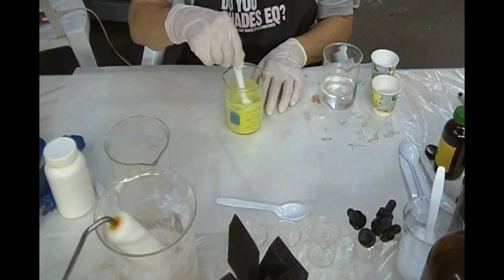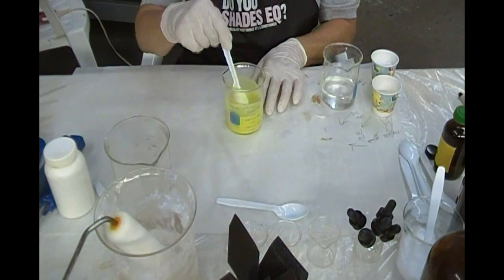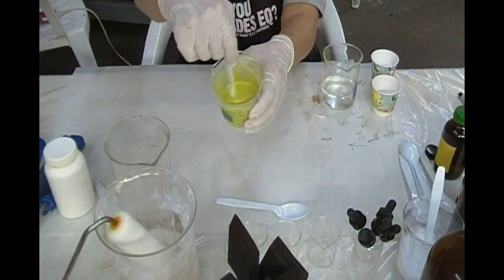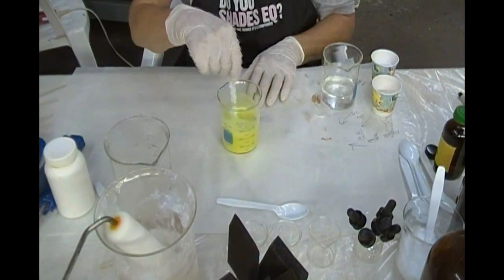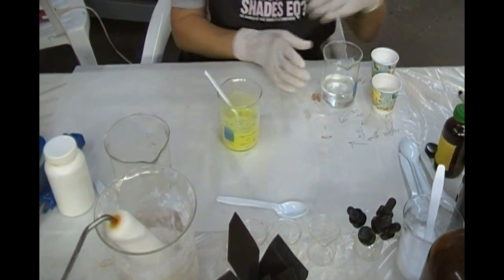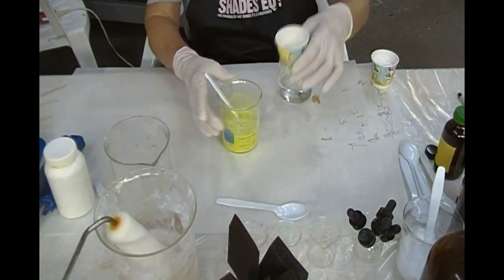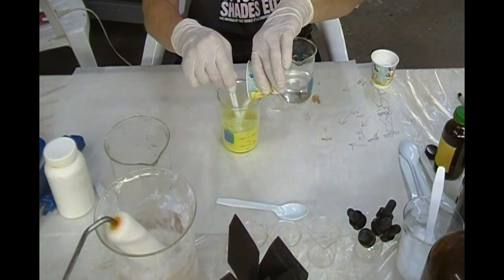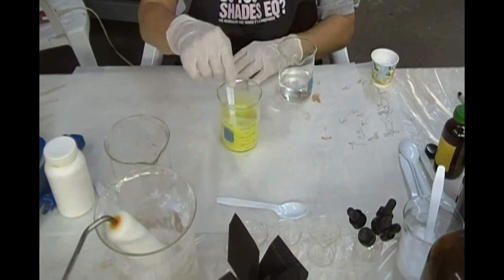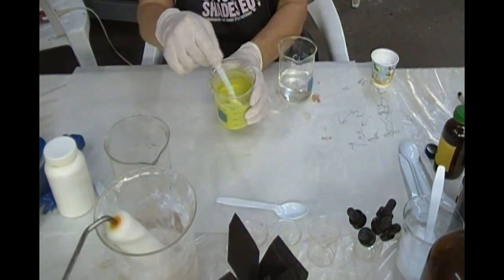Major printers of platinum prints have claimed they calibrate their systems to our ferric oxalate. Now, it's barely soluble in water and typically it would take a half hour or more to dissolve. A microwave would help speed it up, but this process uses some oxalic acid as well, so we're going to add 25 grams of oxalic acid. While we were rehearsing this, I got a baking soda vinegar reaction by dumping one into the other too fast, so when we get to the next stage, you do not want to do that.